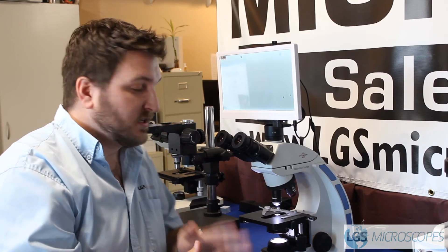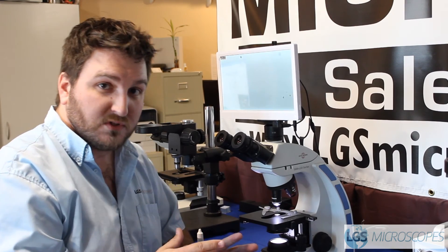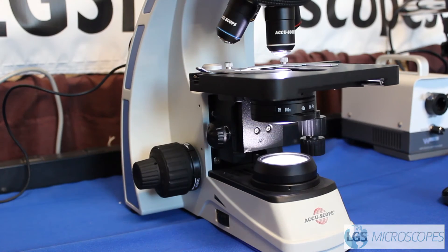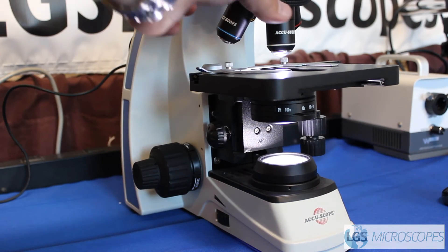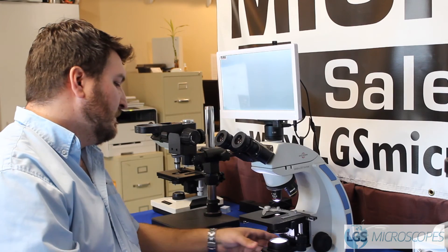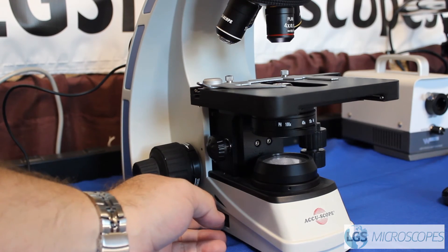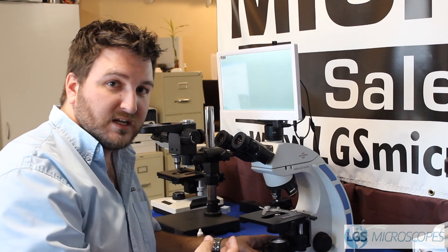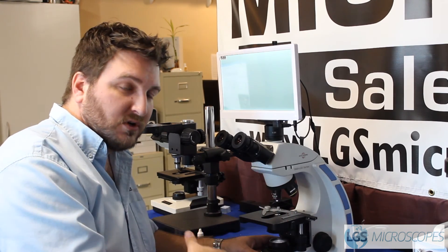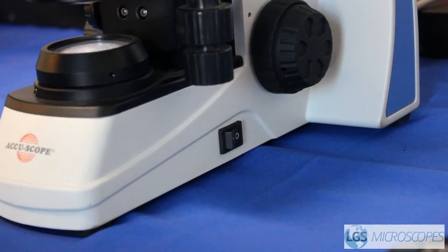Once you've removed your slide and cleaned your 100x objective, go ahead and set the microscope back to what we call first position for the next person. You want to lower your stage all the way down if it isn't already, and set the objective back to the 4x so that there's the most clearance and the least risk of running into anything. Turn the light intensity all the way down — the reason for this is that when you turn the light bulb on at the lowest setting, it gives it a longer overall life than if it were already on the brightest setting. Then turn the power switch off and you're good to go.